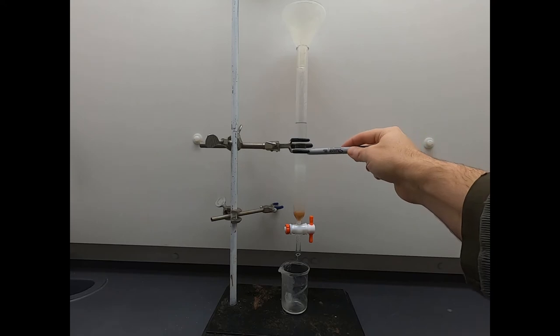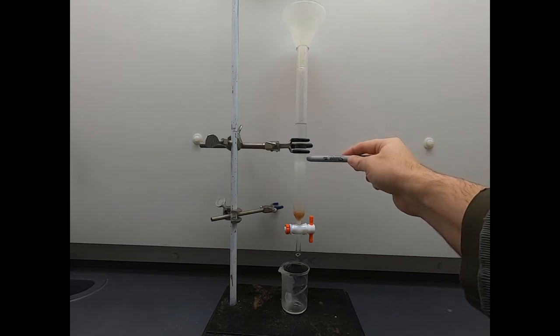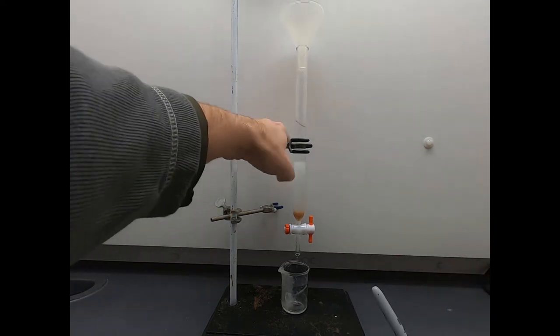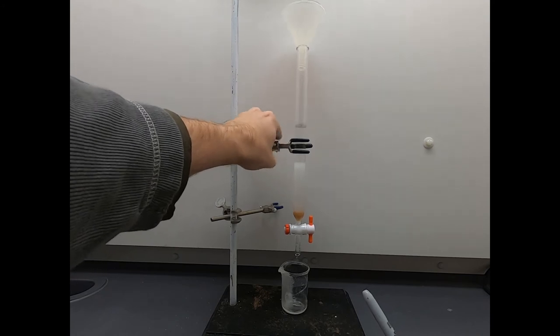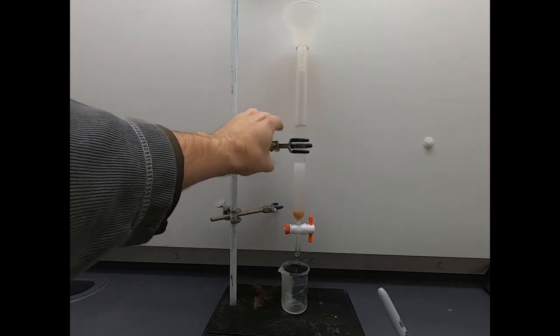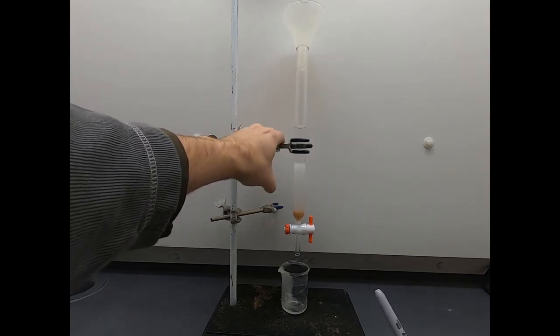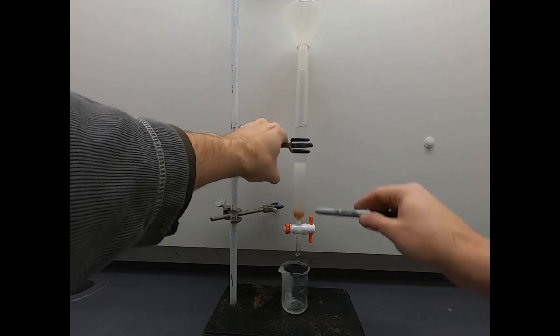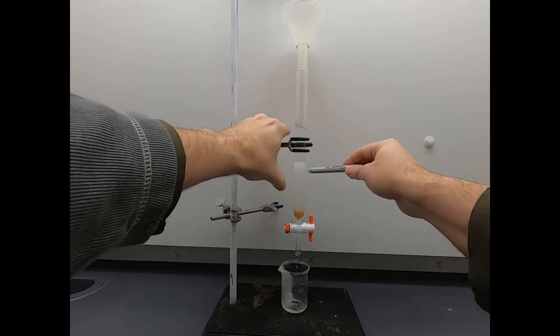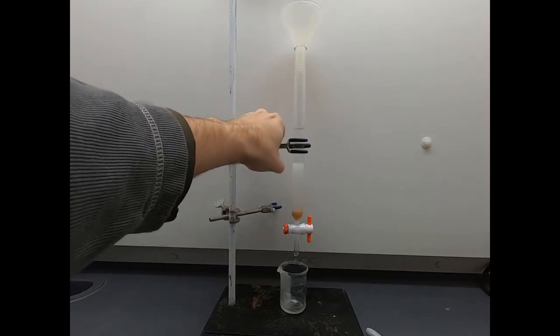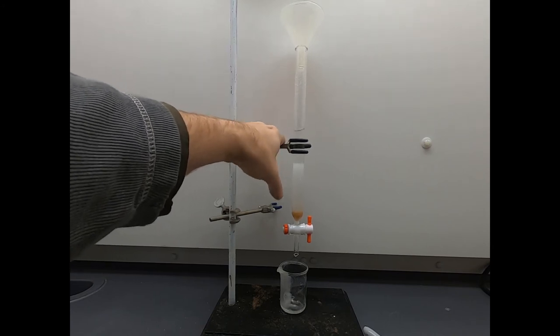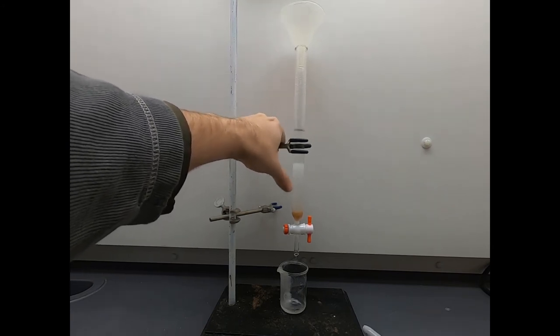Settling down, settling down. I think it's done. That's great. That's certainly enough for our purposes. And as I tap this, this has settled down just a little bit, meaning the level of silica gel is sort of settling deeper. That is packing a column.